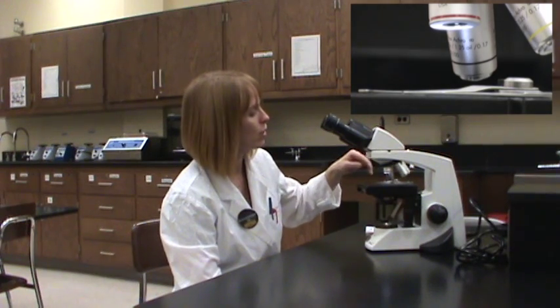You really need maximum magnification, which in these microscopes is 1000x. I've got everything focused and centered. Now I'm going to swing the 10x lens out of the way, which will allow me to place a drop of oil right onto the slide. I'm going to open my oil, scrape off the excess oil from the applicator tip, and simply touch the applicator tip to the surface of the slide, transferring oil to the surface. Where do you aim? You aim where the light is — that's where the lens is going to go. Then once you've got the oil on, you can swing the oil immersion lens into the oil. It's called the oil immersion lens because it needs to be immersed in the oil for proper function.